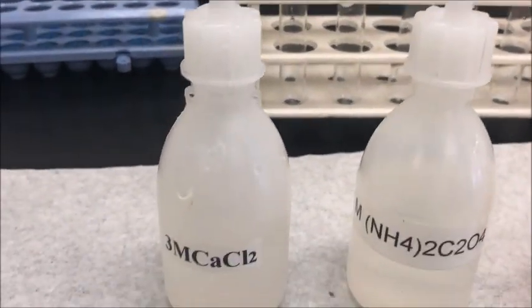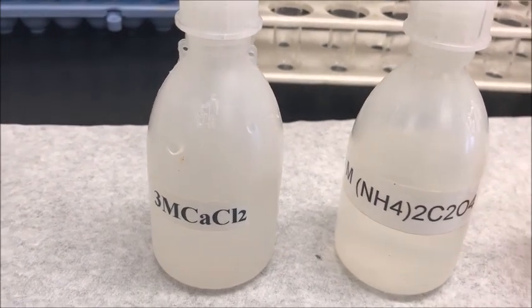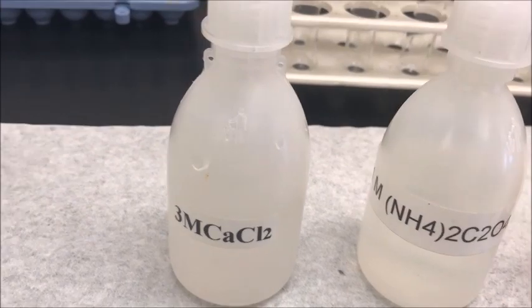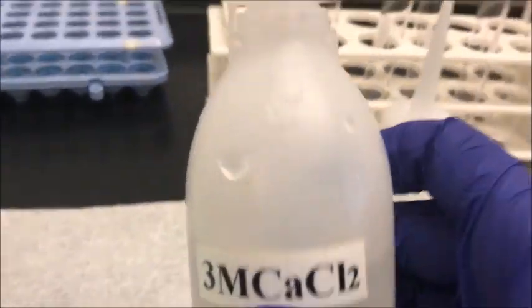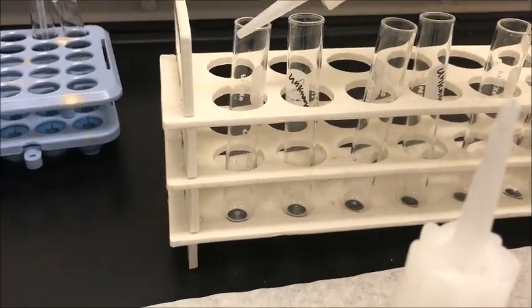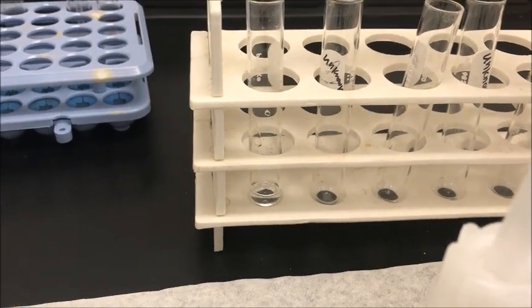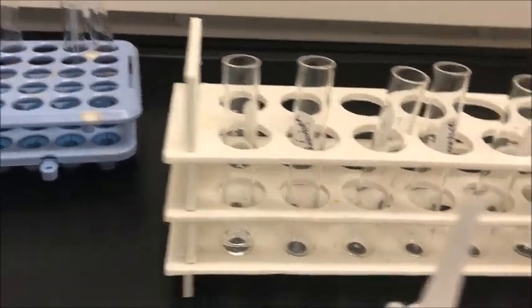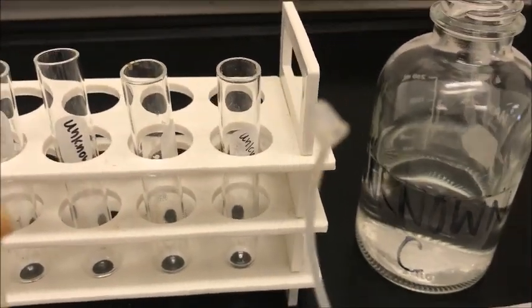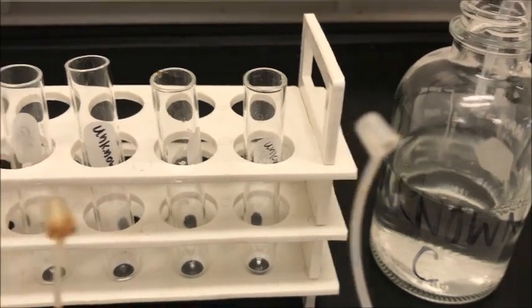The calcium ion reacts with ammonium oxalate and gives a white precipitate. We add 1 ml of the known calcium solution and 1 ml of our unknown solution. I am taking unknown C to test whether calcium is present or not.